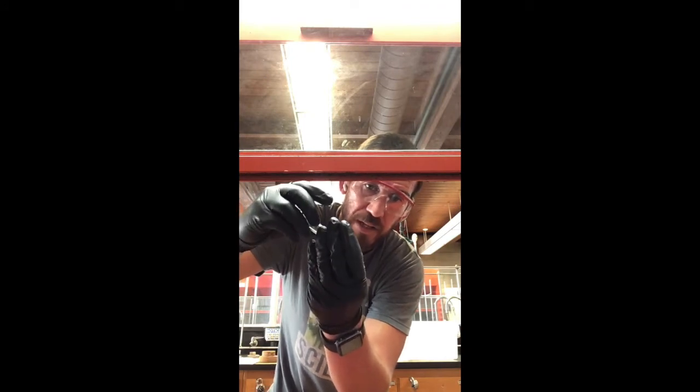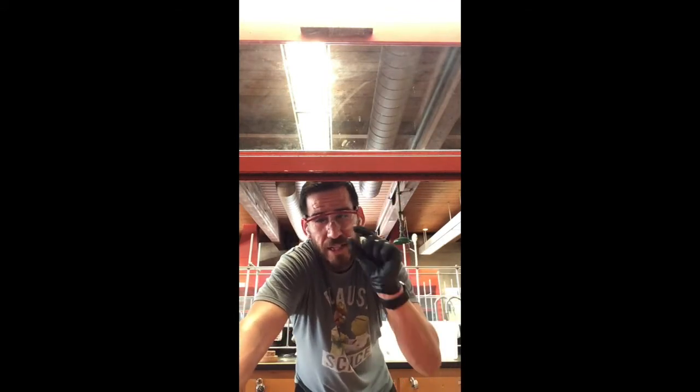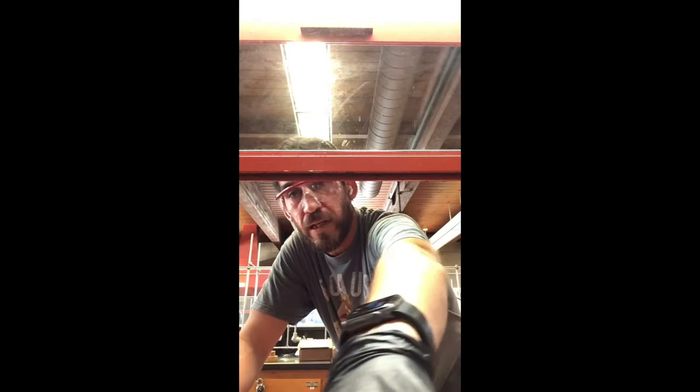It might be done. What I'm going to do is let that hang out for a minute or two, and then I might add a little bit more to see how that responds. We'll go from there, okay? So, to be continued.